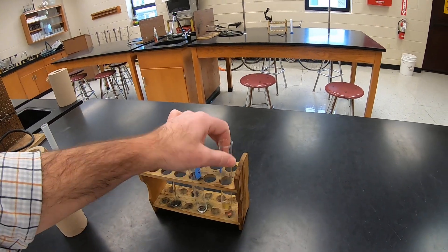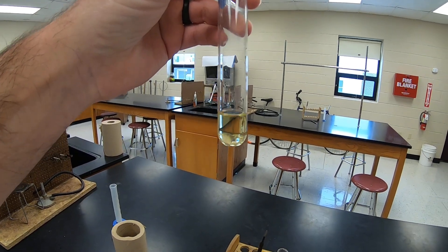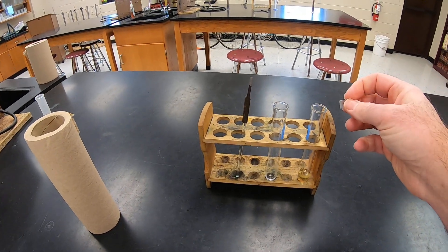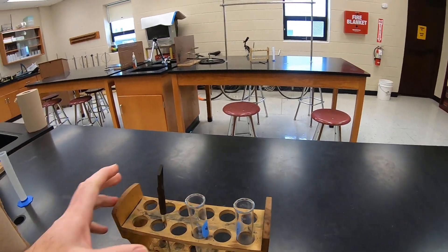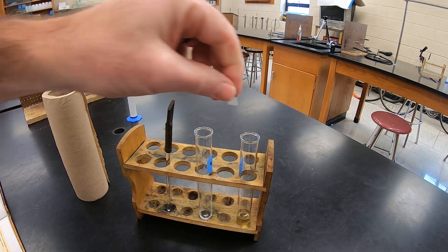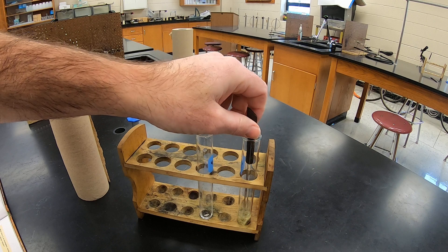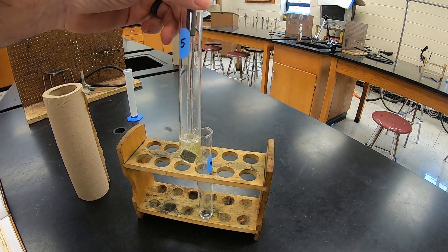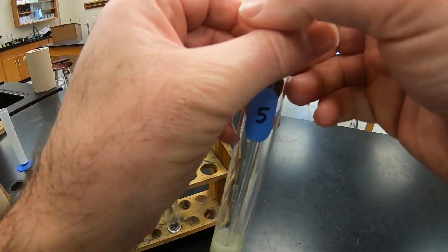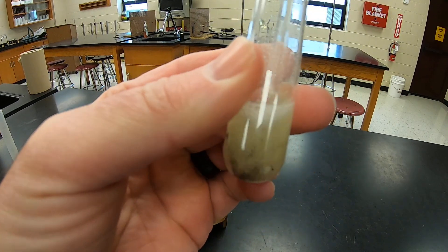This is the copper oxide dissolved in hydrochloric acid solution from yesterday. All that we're going to do is take a piece of zinc and put it in here.